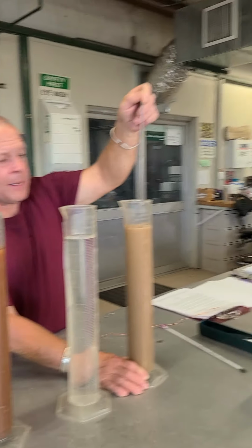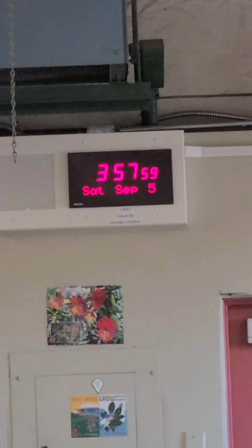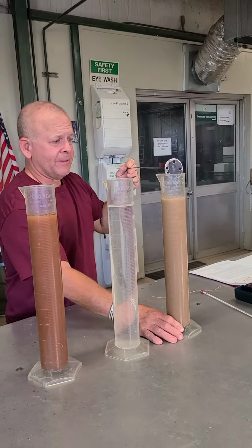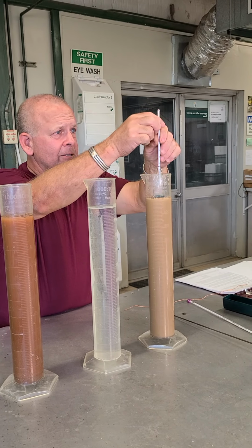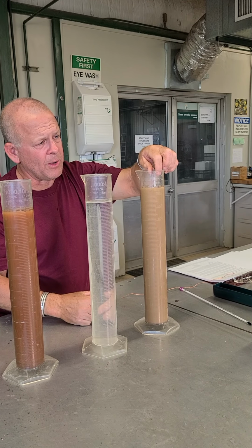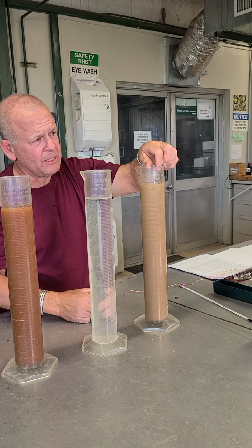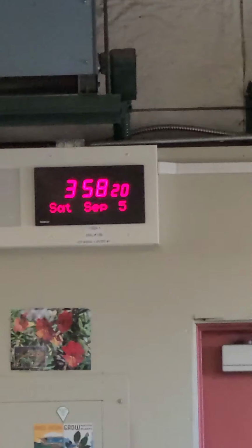So here we are coming up to the top of the hour. I've got 4 seconds, 3 seconds, 2 seconds, and 1. So I'm taking it out at 0. Tip it a little bit. I know I've got time because I've done this before. Carefully insert the hydrometer. You don't want to drop it in there. It's going to want to come up, and you don't know where it wants to settle. So you can see I'm keeping my eye on it. I've still got about 20 seconds. Now it's kind of sitting there.